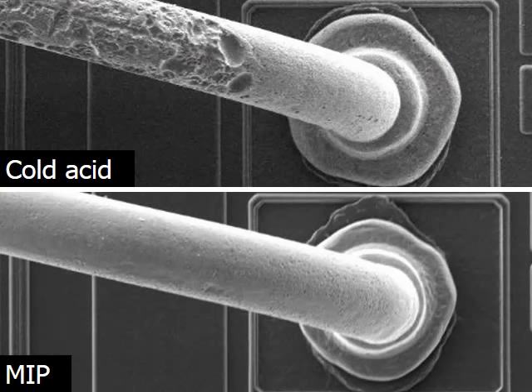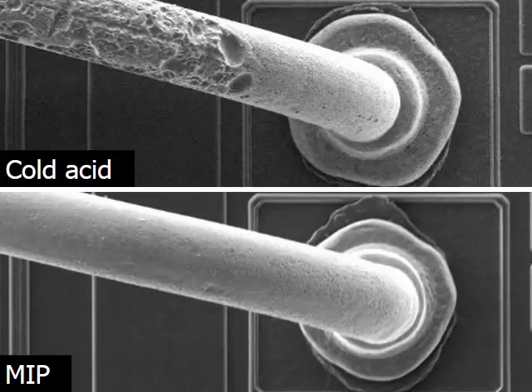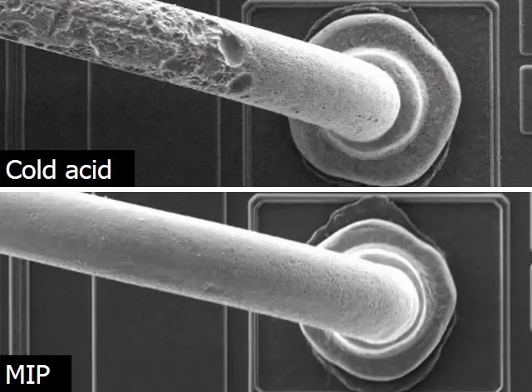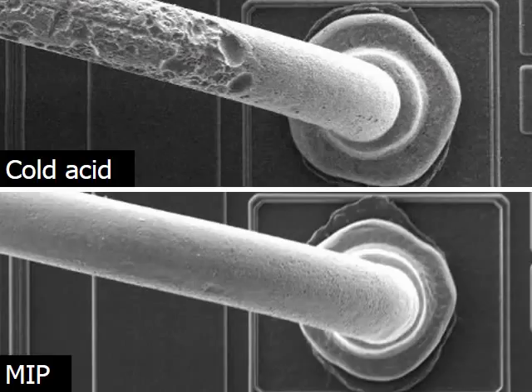These images are taken by SEM, providing us with even closer detail of the palladium coated copper bond wires decapsulated by cold acid and MIP. The cold acid decapsulated process has damaged the surface features, causing corrosion to the palladium coating and also deeper into the copper wire itself, restricting the certainty of further analysis.